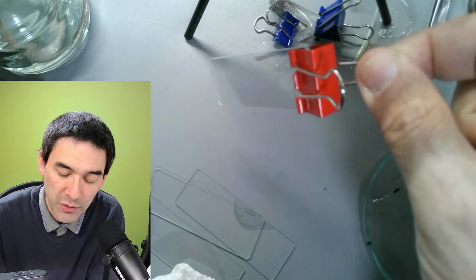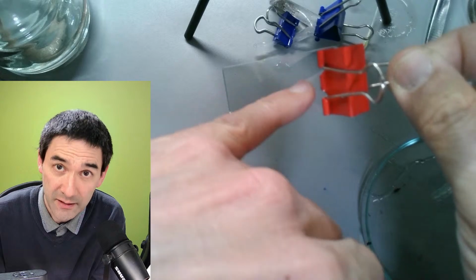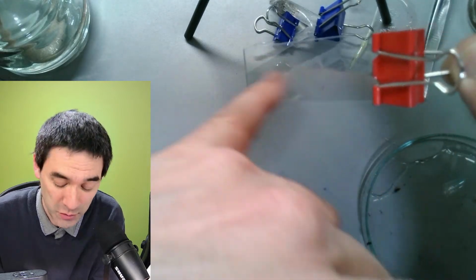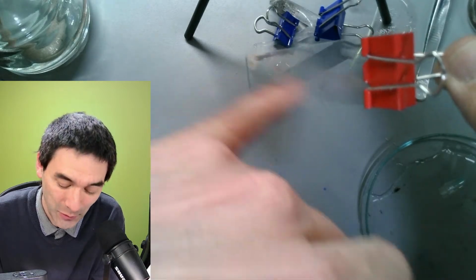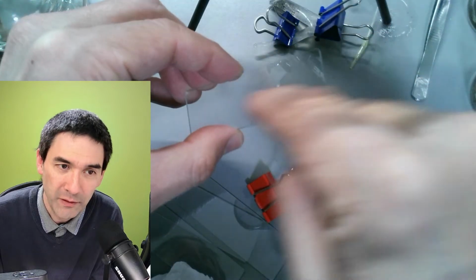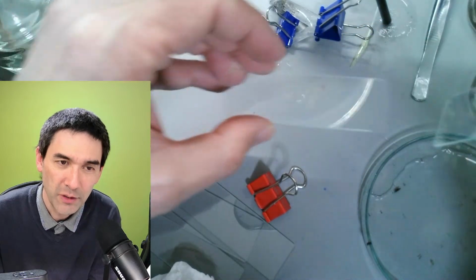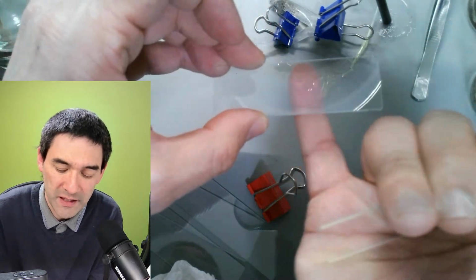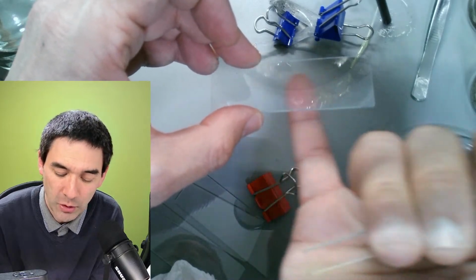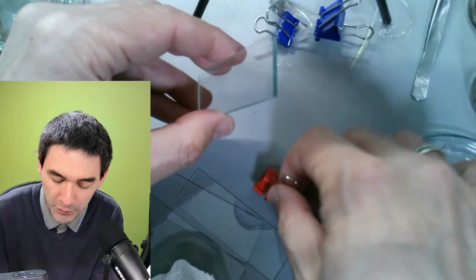Okay. Why would you do that? Because then you will have a biofilm forming on this glass slide. So algae growing, microorganisms, stentors, maybe you watched my previous video, Vorticella, I don't know. Because it's clamped together, the biofilm is only going to grow on one side, and then you can take it off and put it under the microscope. The bottom side will hopefully be free and will not have a biofilm because the other slide was there, right? So this is basically the reason why I bought those.